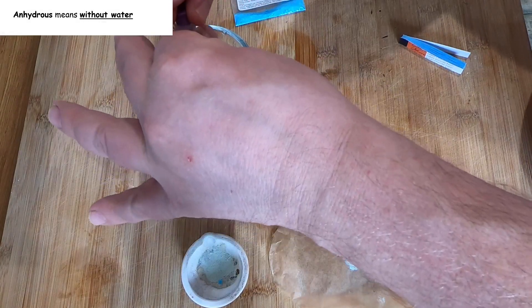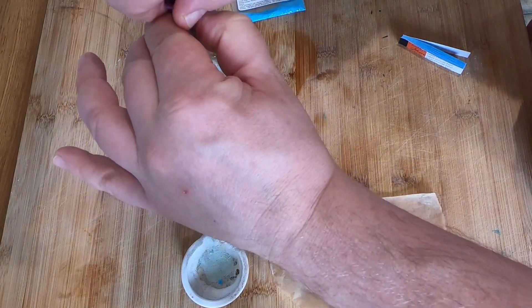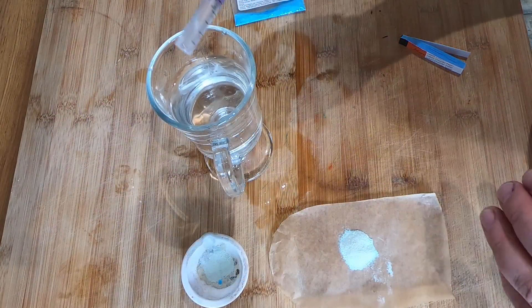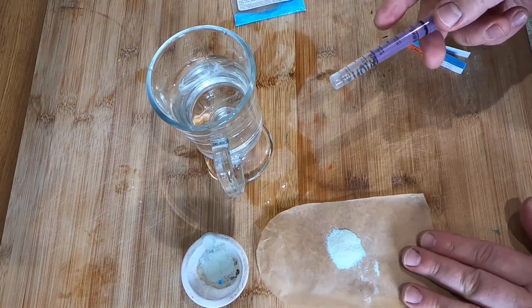So let's find out what happens when you add water to anhydrous copper sulfate. I'm just sucking up some of the water from the glass. And here we go, let's add the water.